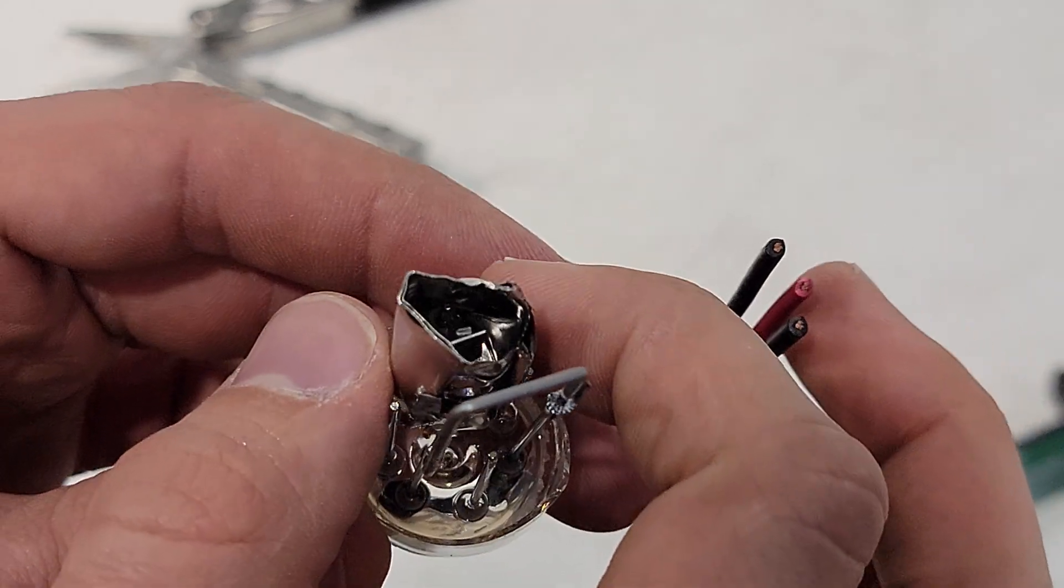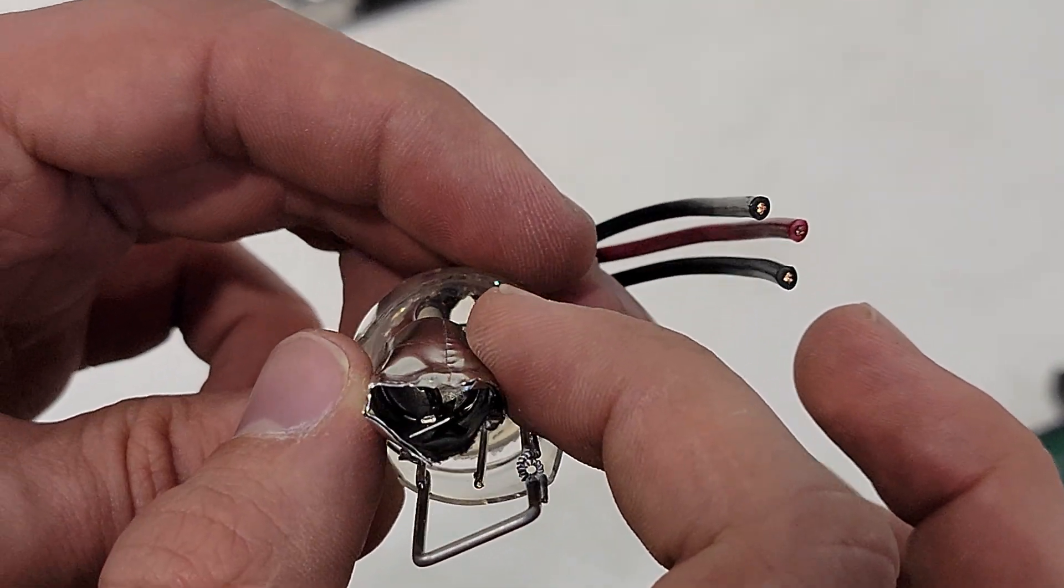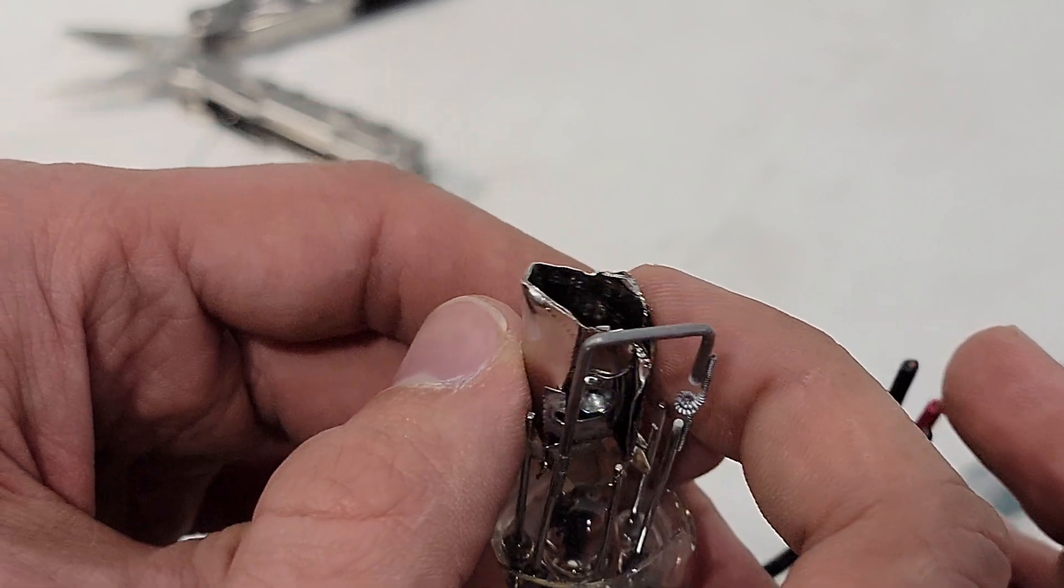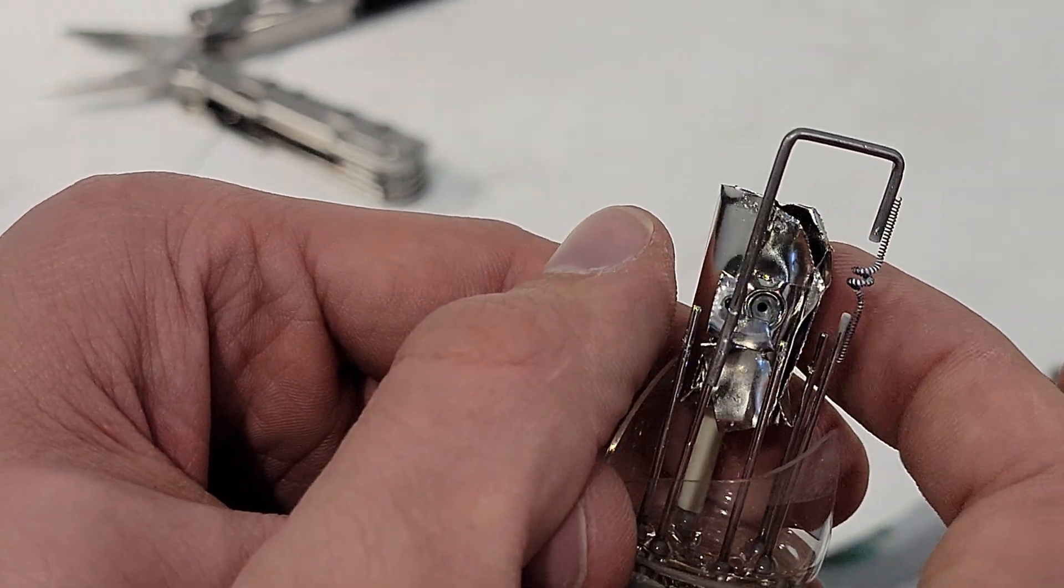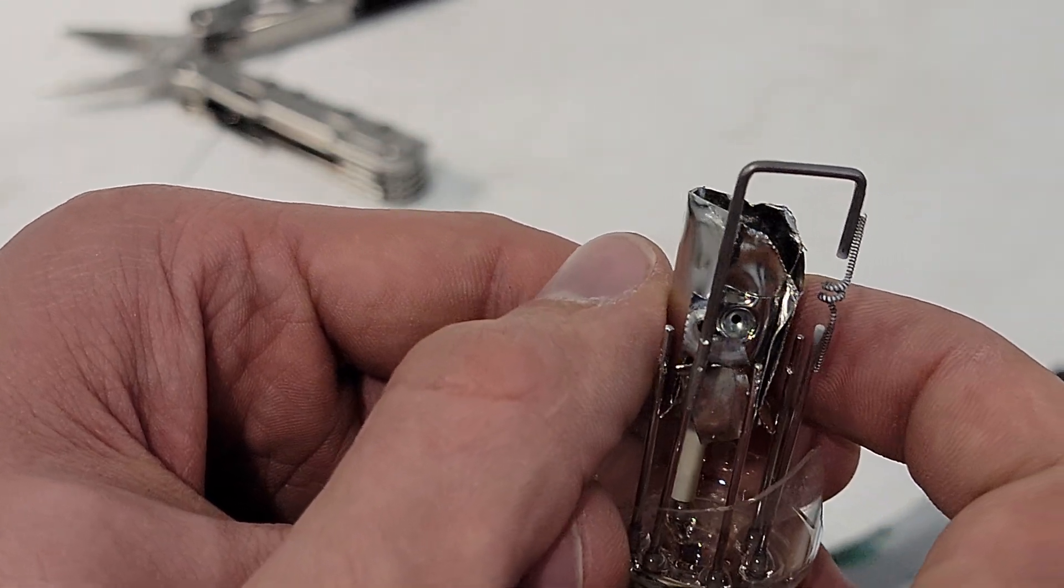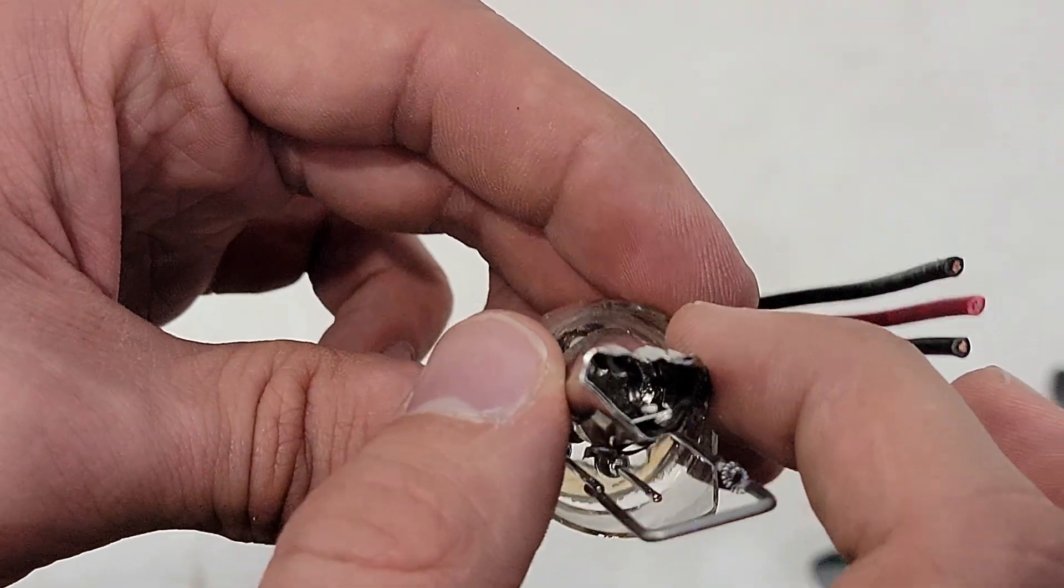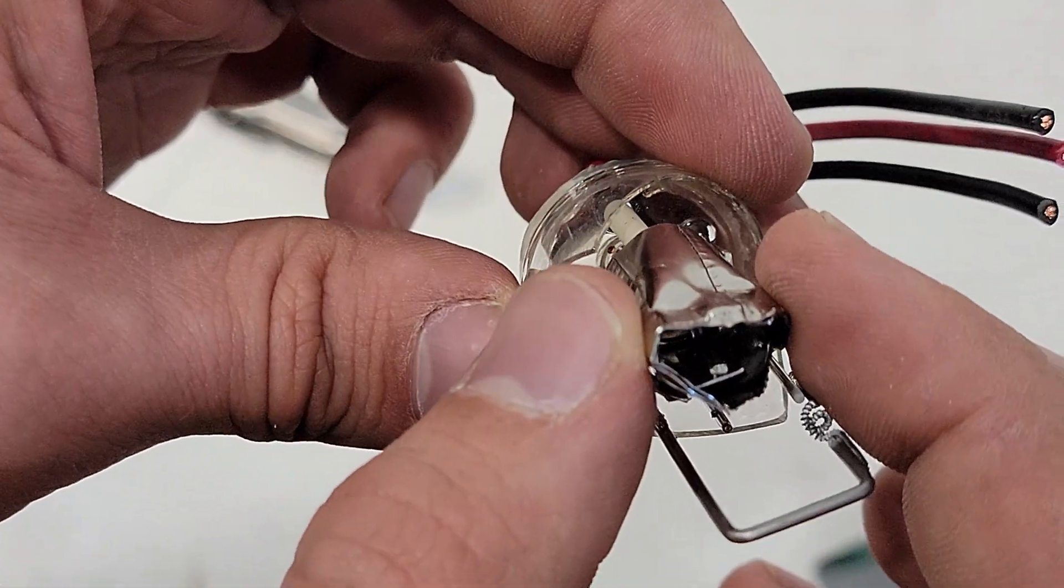Inside the cylinder is the anode, and sitting on the anode is a square plate. I'm not totally sure the reason for the square plate, but I know that most of the geometric design elements of the bulb are used to produce even, bright light coming out of the bulb and increase lamp life.